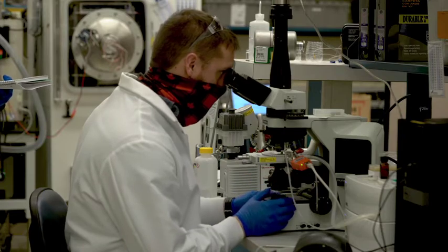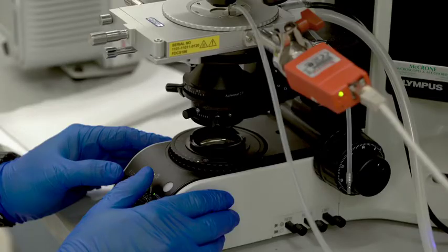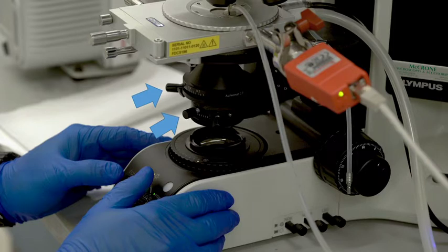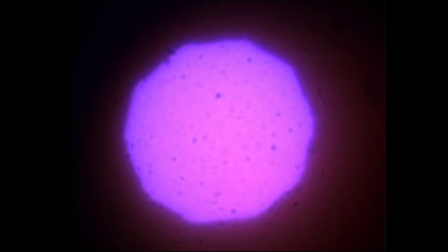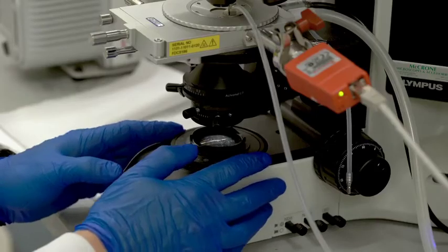Use the optical train focusing knob to bring the light source into focus. A properly focused optical train will give the appearance of a decagon. Open the aperture.